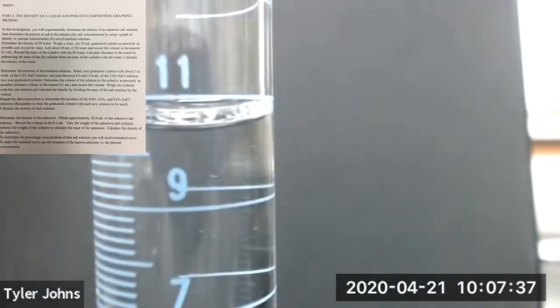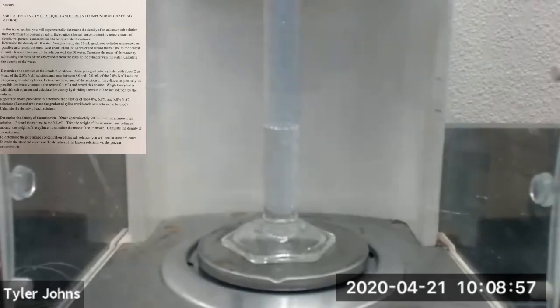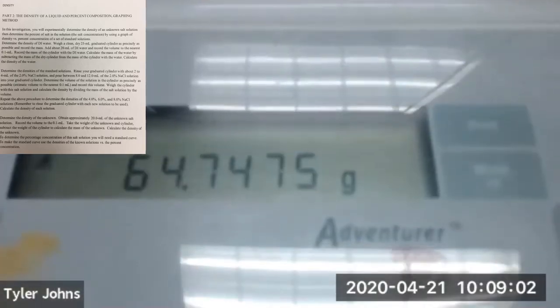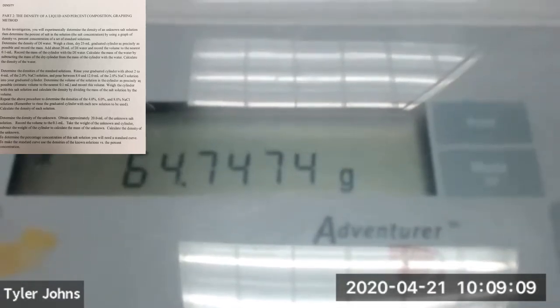All right, so this is the volume of our 2% salt solution in our 25 mL graduated cylinder. We're next going to determine the mass of the graduated cylinder plus this volume of 2% salt solution. Okay, so the mass of our 25 mL graduated cylinder plus the volume of 2% salt solution that we added is 64.7475 grams.